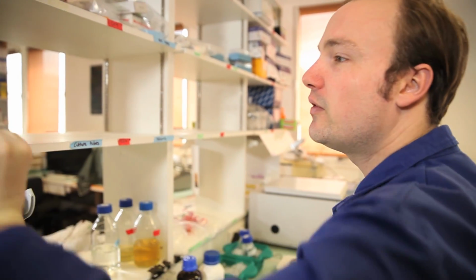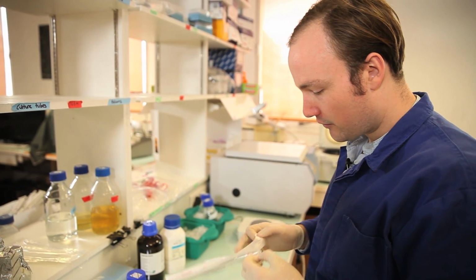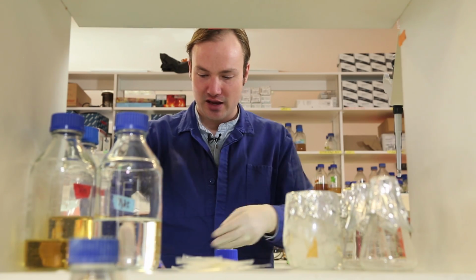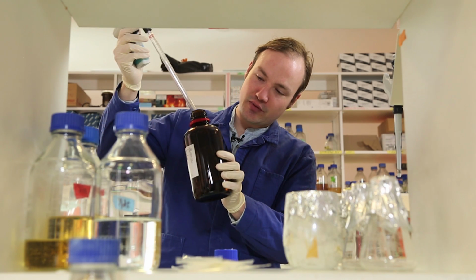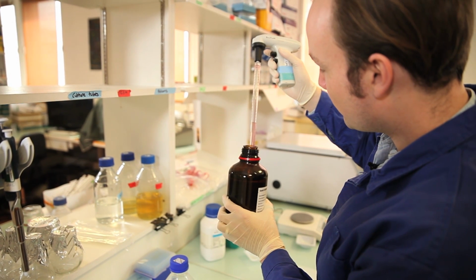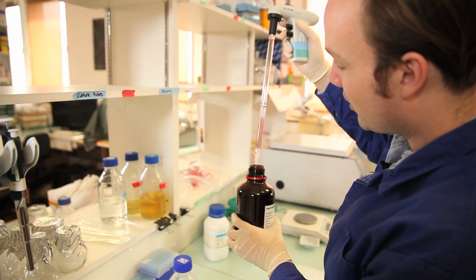Now let's pipette the glycerol. I need 15 mils of glycerol. For this, I'm using 100% glycerol solution, and it can be a real pain to pipette, so I'll have to be extra careful. One tip here is to put just the tip of the pipette into the glycerol, because otherwise the entire pipette will be coated with glycerol. Be a little patient to get exactly the right level. Let the excess glycerol drip off.